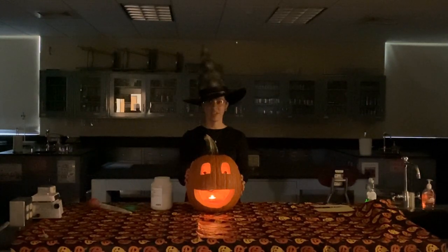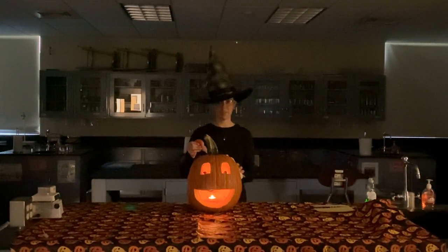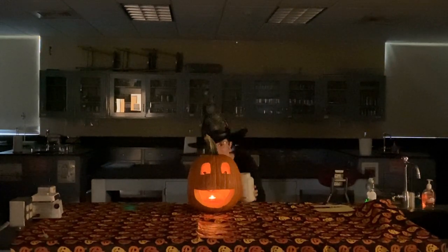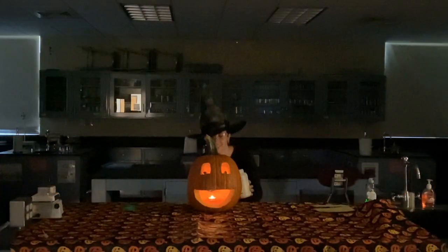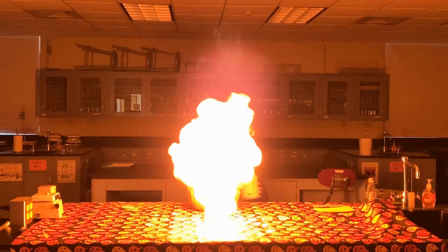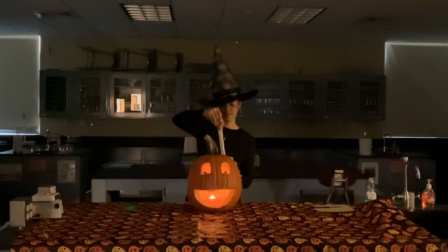Thank you, Mr. Roberts. Okay, so we have our pumpkin here. We have our nice little jack-o'-lantern. So let's see if we can get this pumpkin to breathe some fire. I'll do it a couple times and we'll see what we can do. Bring it up. Oh, that one's done. Oh, there's a good one. We'll do a couple more times, and then we'll figure out what the heck is going on here. All right, I'll do one in slow-mo for our final one here. Nice. All right, so let's figure out what the heck was going on there. Go ahead, Mr. Roberts.